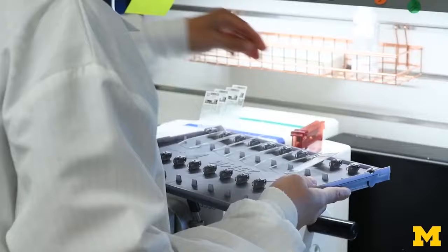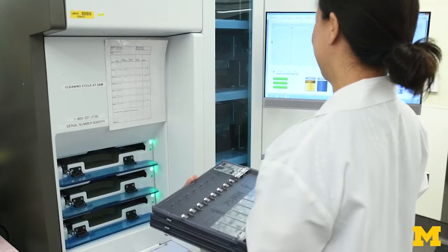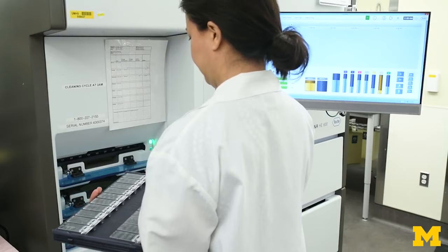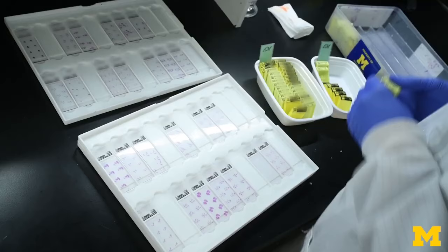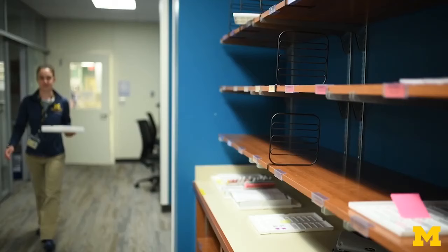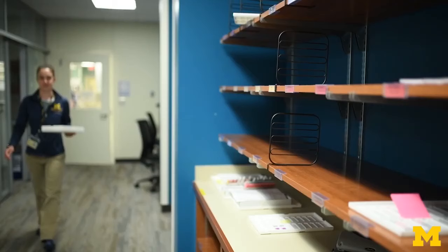This enables the histotechnologist to pick up the incredibly thin slice and lay it perfectly flat onto a glass slide. The glass slides are collected onto special trays and entered into machines that stain large batches of slides uniformly and efficiently. At the end of this process, the machine also places a glass cover slip on the slide, which will protect both the specimen and the microscope. When the trays of slides are removed from the machine, a final quality check is completed, and the slides are then ready to be examined by a pathologist.